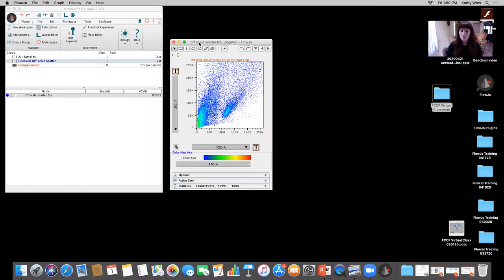So this is a really good example here, because what do we see straight away? We see straight away that there's a warning right here that 88% of the events are on the chart edges. So this is someone that was utilizing one of the sorters that we have, and they were running an experiment. And after the fact, they came back and they had 88% that was on the edges, okay?